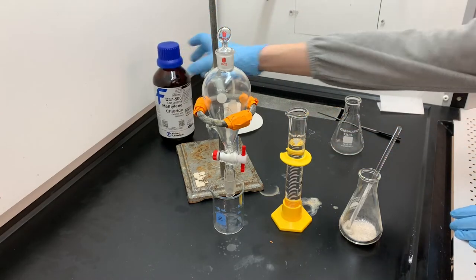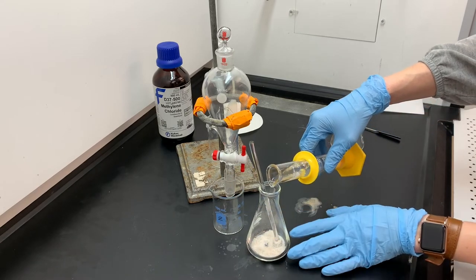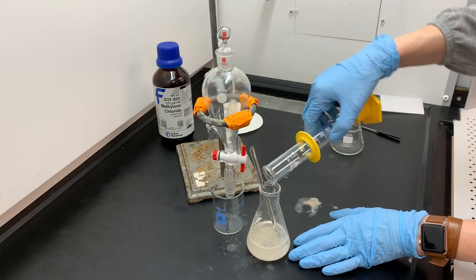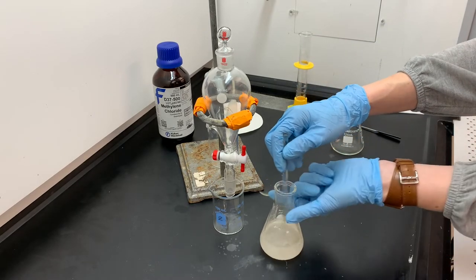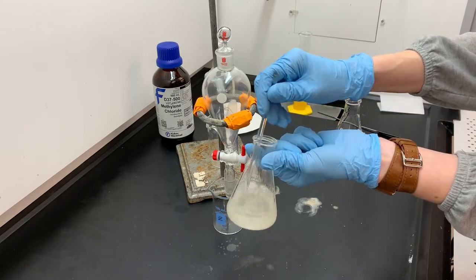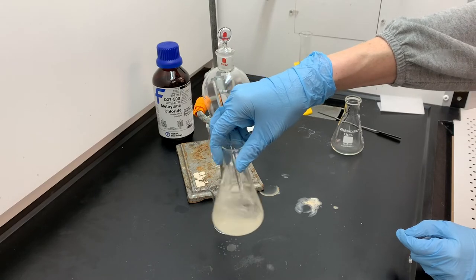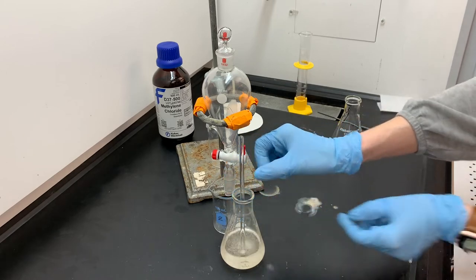Methylene chloride is pretty toxic, so you want to be careful when working with it. Keep in mind that the sucrose is not going to dissolve in the methylene chloride, so we're not expecting to see everything dissolve. Some components are going to stay solid, which makes it a little tricky to know exactly when the solution has dissolved as much as it can. So we're just going to give it time, stir and swirl quite a bit, looking for a point where it doesn't appear to be changing anymore in terms of its cloudiness or the amount dissolved.